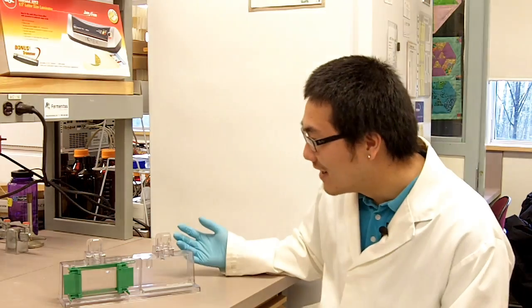Is that gel leaking, Dan? Are you serious? Oh my god! Way to go, Dan.